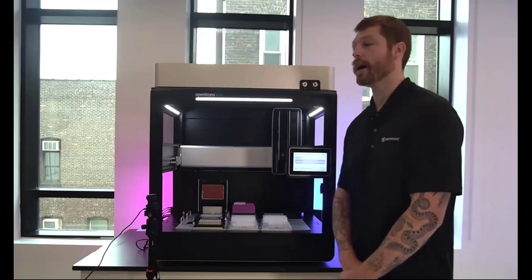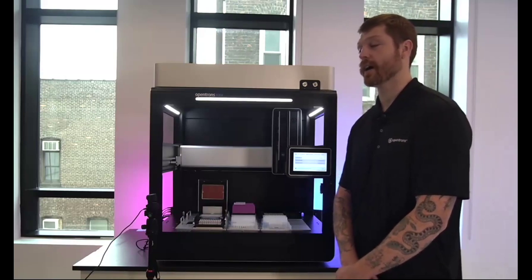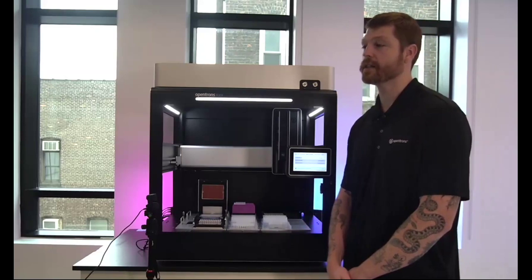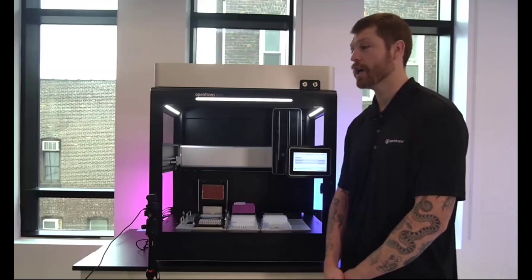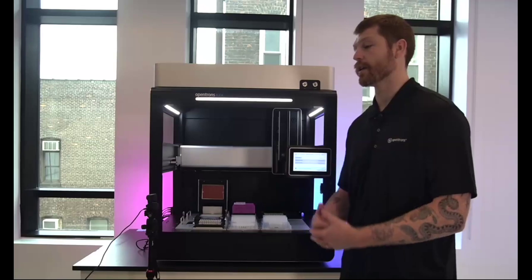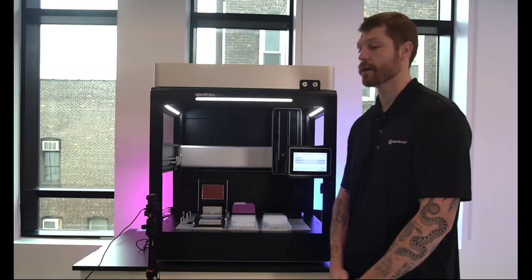Yeah, absolutely. So as I highlighted quickly in the code there, you really just need to specify the column headers for your CSV in order to say what is actually going to be referenced within this, and then essentially just tie that into the parameter that's going to be using that throughout the protocol. So whether that's specifying the labware, the location, or the volume, right? You tie that to the name of it, and then you'll just iterate through the CSV through those steps there.